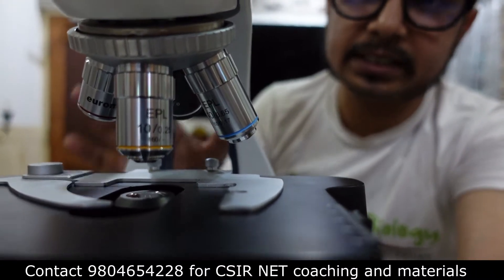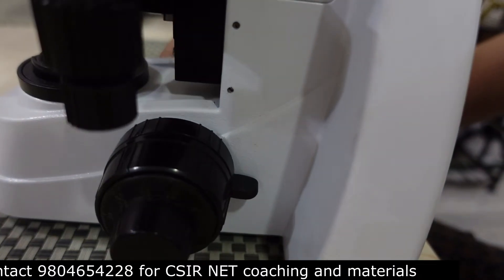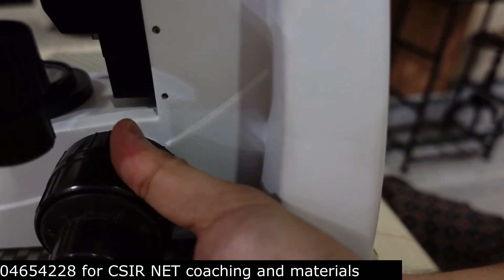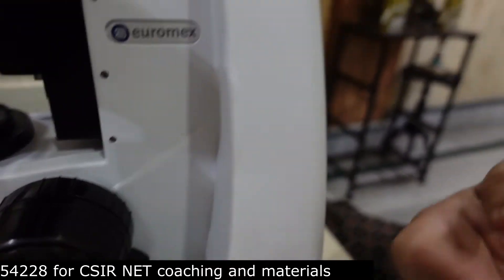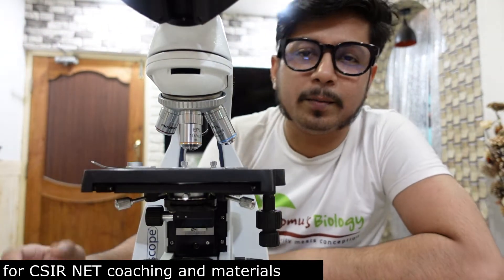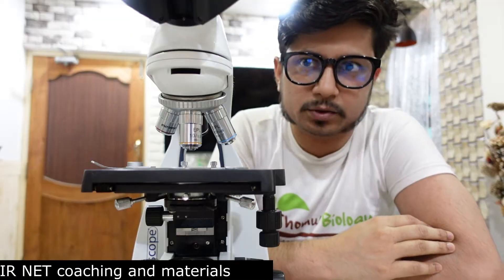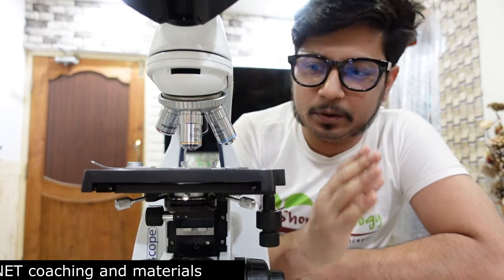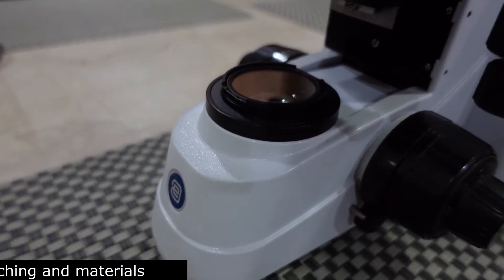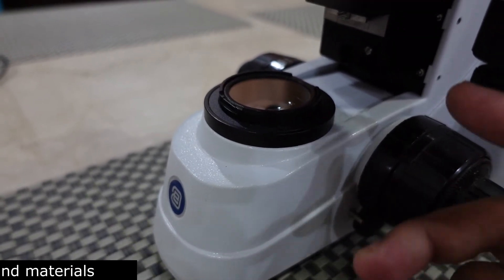It's very important that you understand these components. One more thing to understand is the adjustment knobs. The broad one is the coarse adjustment and the small one is the fine adjustment. I'm now going to state the important functions of individual parts of the microscope and provide some tips regarding handling.